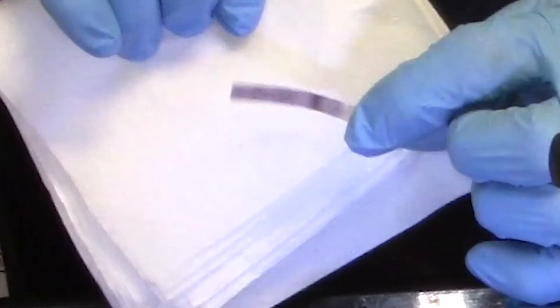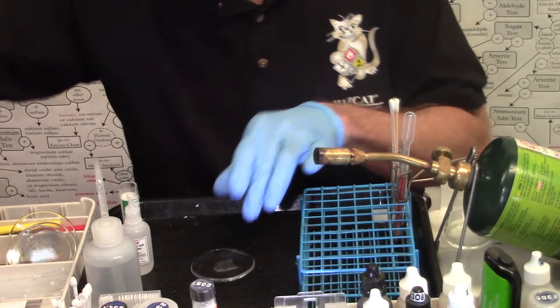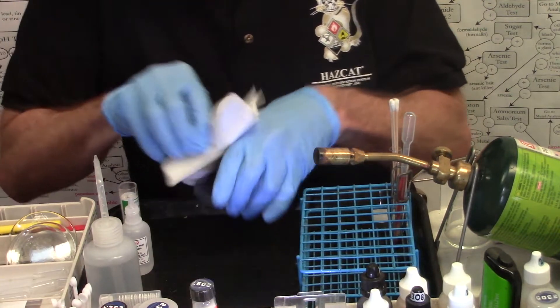Okay. Once again, I have a positive oxidizer. You can see by the deep blue black color on the paper there. All right.